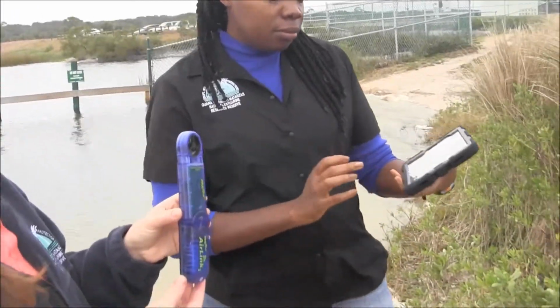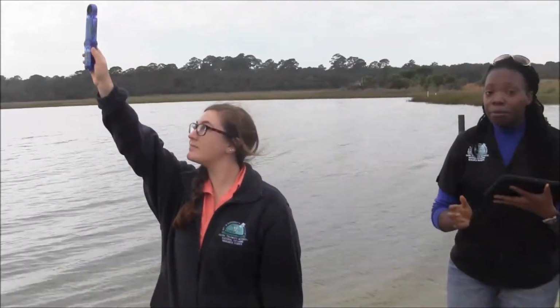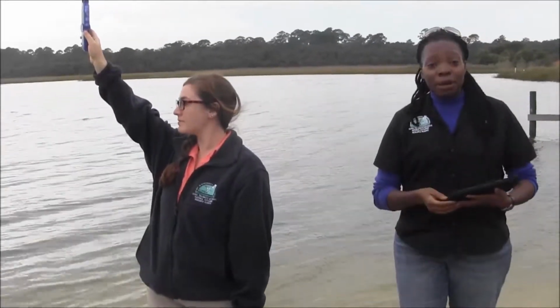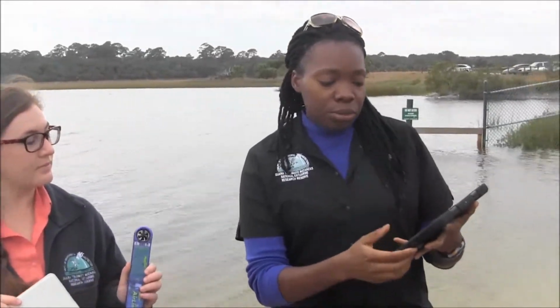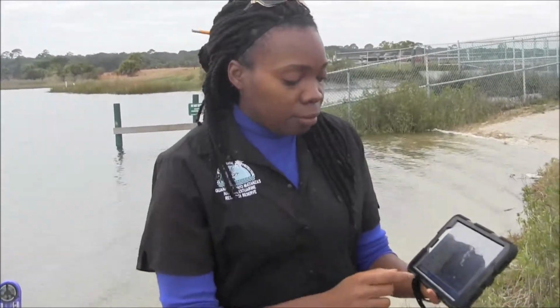Alright, once it's connected, we can go ahead and have your volunteer hold it up towards where the wind is coming from, kind of like the Statue of Liberty. And you're going to press that green play button, and it'll run for about 30 seconds. Alright, so it's been about 30 seconds. You're going to go ahead and write those measurements down into your data binder, and then you're also going to save it into your SparkView application. And again, how you save it is you press that triangle at the top of your application, click on Save File, and then we're able to go back and look at that information if we need to.